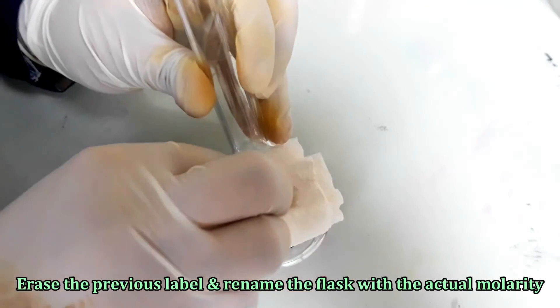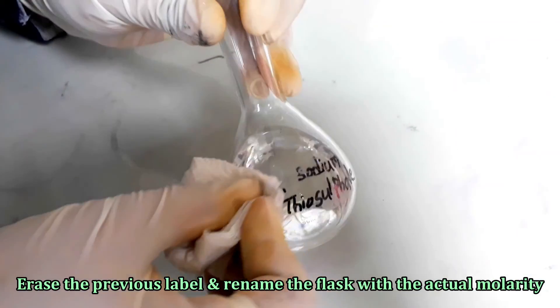Let's correct the label of the flask containing sodium thiosulfate solution.